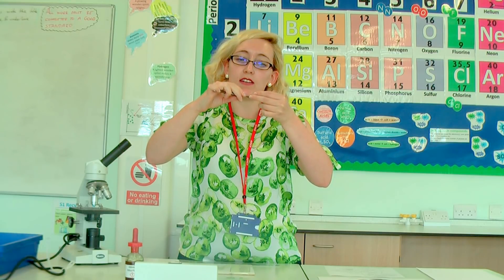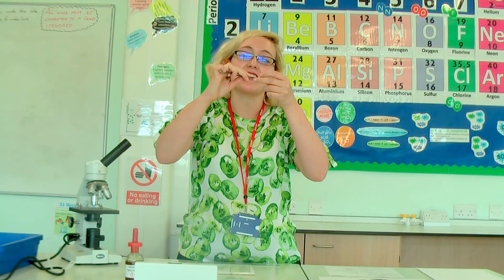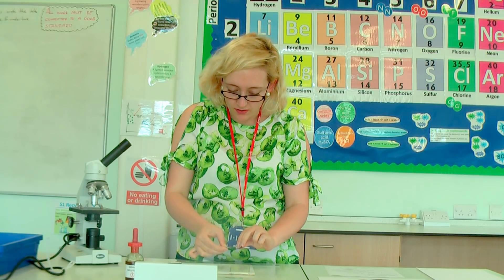So we've got our red onion here. I've taken one layer, and on the inside of this there is a very fine layer of cells. I'm using my forceps and I'm going to peel off that top layer of cells. This can be a little bit tricky — it looks a little bit like skin when it's coming off, and that's because it is skin. This is the inner layer of the onion skin.